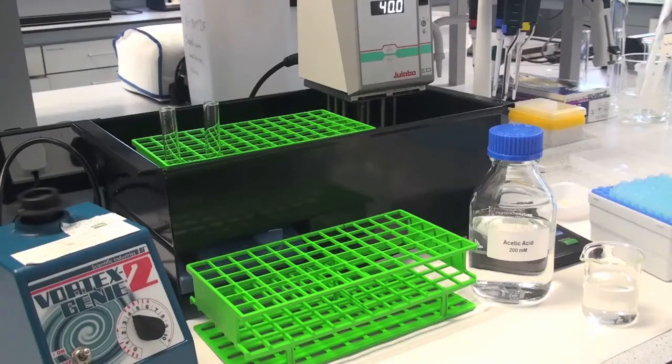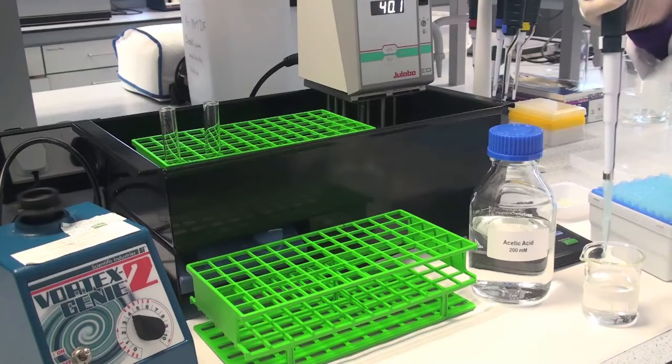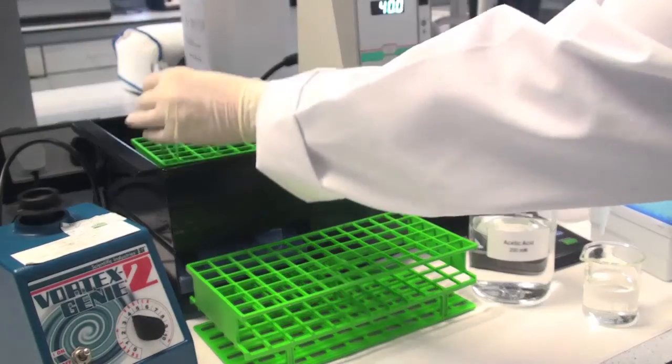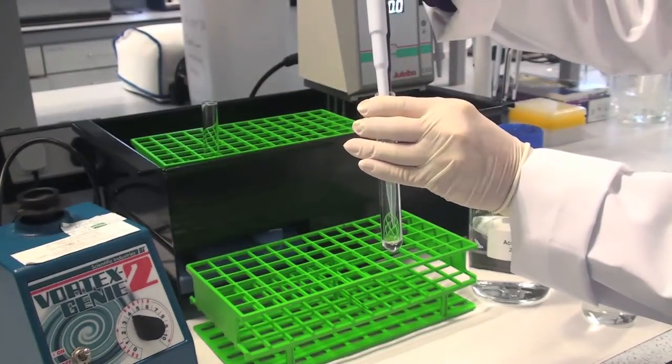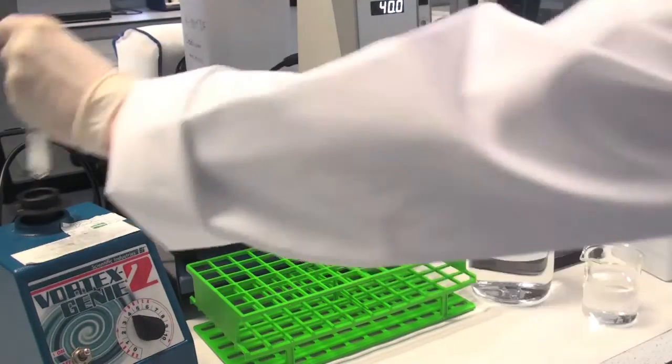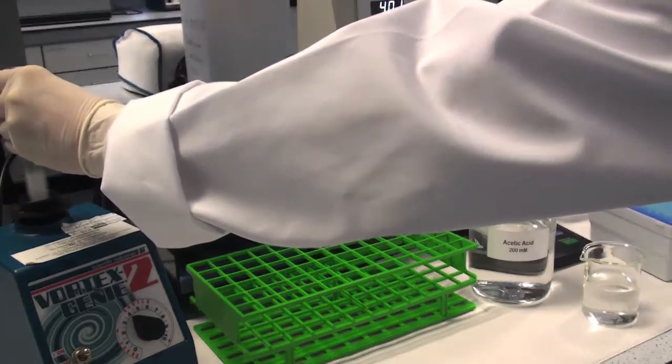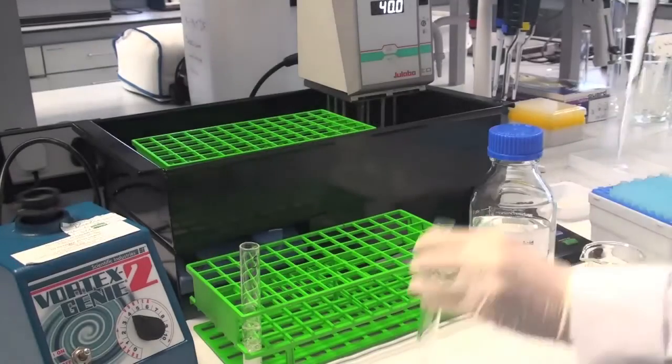Add 0.5 ml of reagent 4, 200 millimolar acetic acid to the tube with vigorous stirring on a vortex mixer. A vigorous effervescence should be observed. This treatment removes excess borohydride and adjusts the pH to approximately 4.5. This is termed solution S.